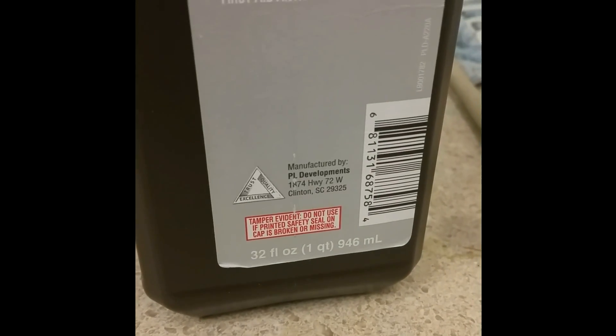Hello, making this video to demonstrate how to make concentrated hydrogen peroxide starting from the diluted stuff you get from Walgreens or Publix — that three percent solution you can buy in a one quart or one liter bottle. If you want concentrated stuff, especially for doing the famous elephant toothpaste demonstration, which I'm doing for my church kids ministry, you have to do this. There are a lot of methods I've read about and seen videos on that don't work.